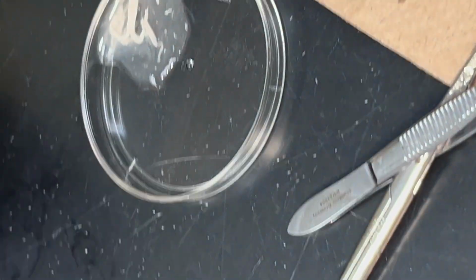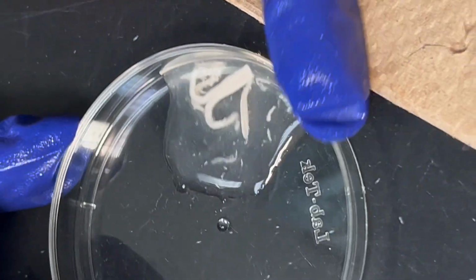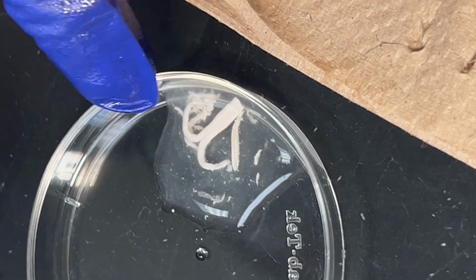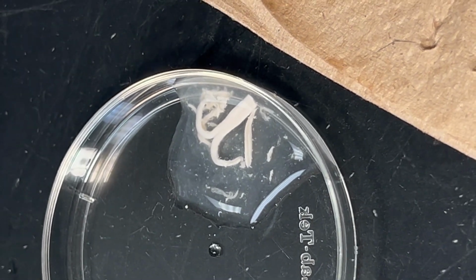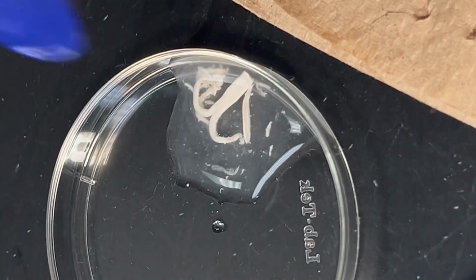And see, it broke, but actually it's better than before. So here, look at this. Do you see how different that ventral part is? It's super wide and has almost a camel kind of shape. That's what tells you it's the ventral part. And if I switch it, you're now gonna see how the dorsal would look.